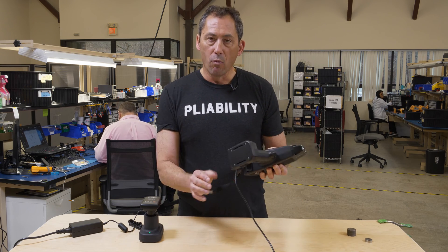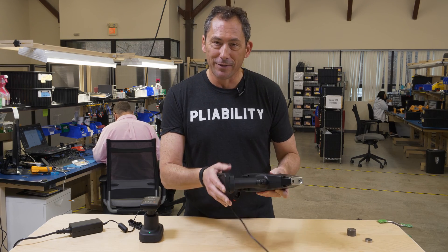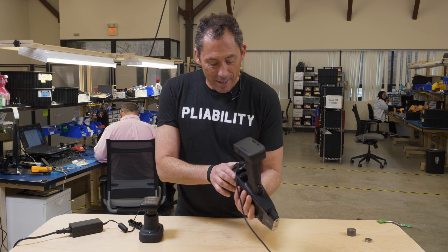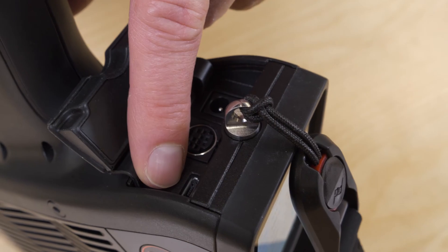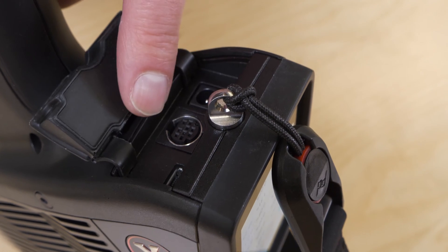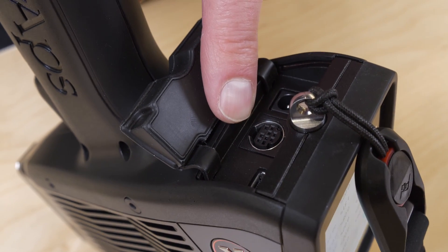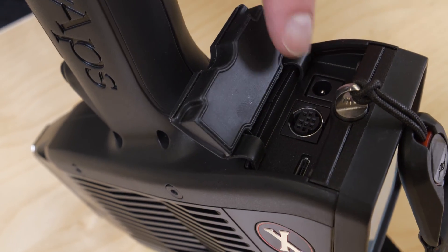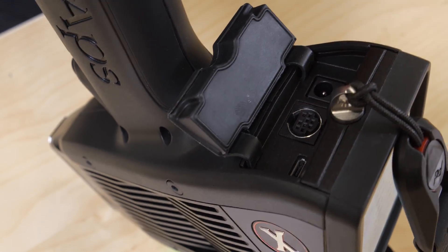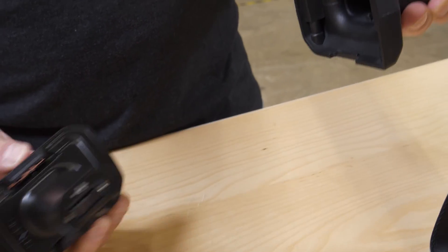As you can see, I'm wearing my wrist strap. We warranty the unit to drops, but we ask that you wear the wrist strap when using it — it's not an inexpensive analyzer. On the underneath side we have the ports: right now I'm connected to the USB port for the camera, there's also a data port for field firmware and software upgrades, and then there's the AC power port if you want to run the unit by AC power and also charge the battery.